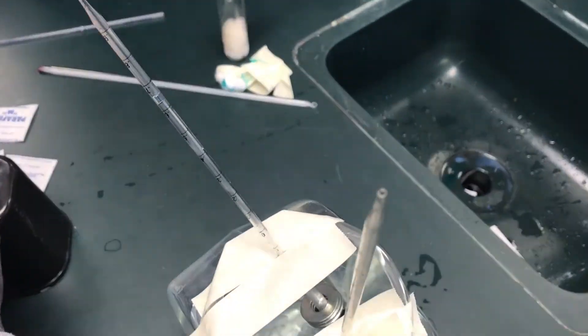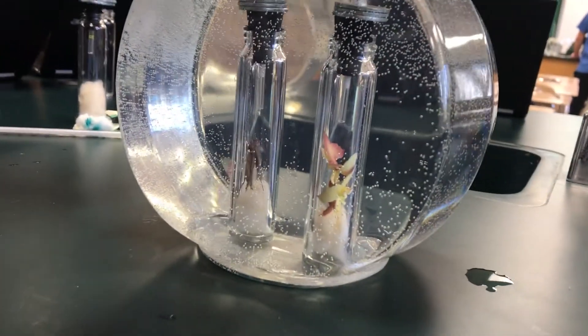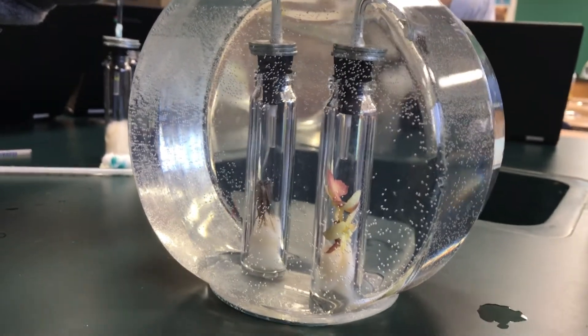But don't worry, no crickets were harmed during the making of this video. The seal with the parafilm paper ensures that there's no water getting inside those chambers.